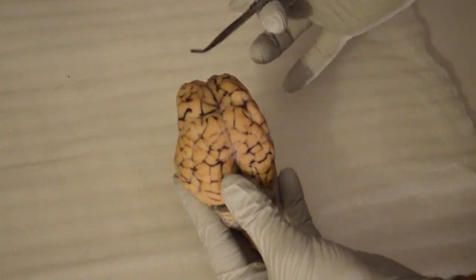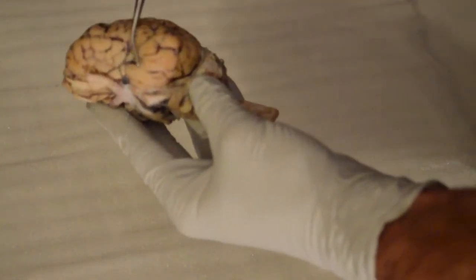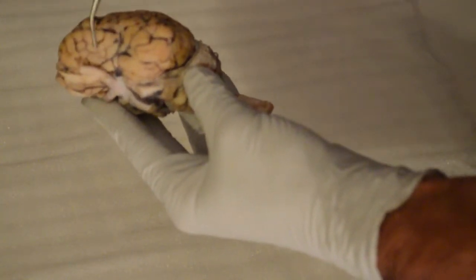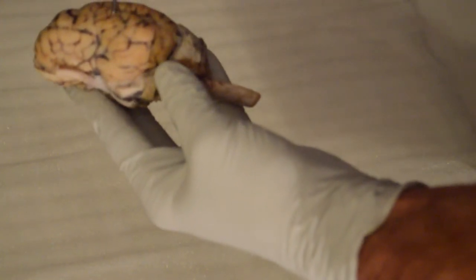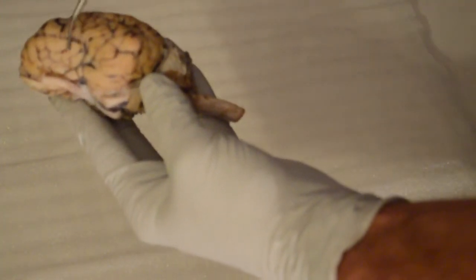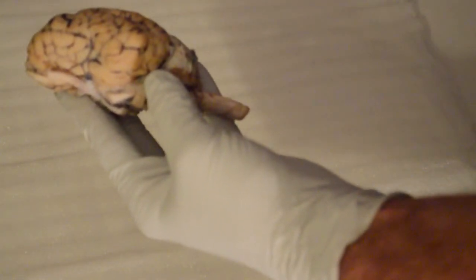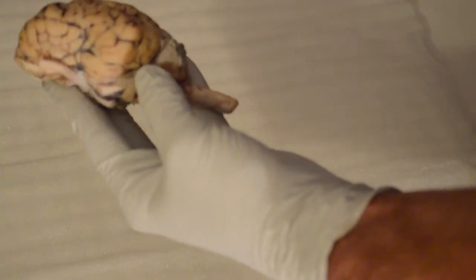Next, we'll move on to the lateral sulcus. The lateral sulcus is right here along the temporal region of the brain, which separates the temporal and the parietal. Okay, and that's very, very important. This is actually right behind the zygomatic process of the frontal bone, which is going to be placed right about there, give or take. The fissure, of course, distinguishes between the temporal and the parietal.